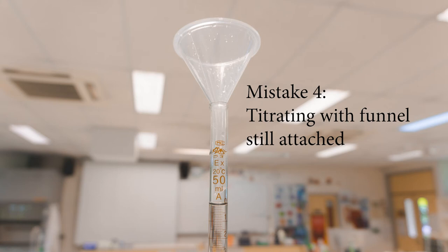Mistake number 4 is that students often do not remove the filter funnel from the burette before titrating. As mentioned before, one or two drops could trickle in from the filter funnel and cause inaccurate readings.